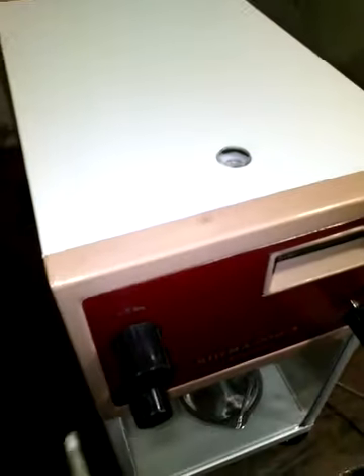This is the internal view of the balance. To observe the internal part of the balance, the top cover should be removed. We remove the top cover of the balance and proceed towards the internal area. This is the internal view of the balance, which consists of many parts.